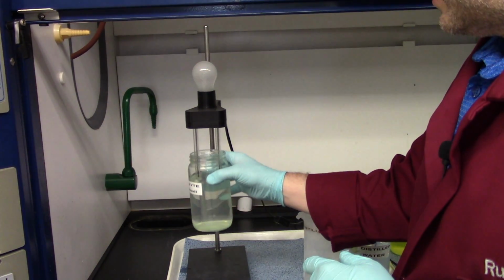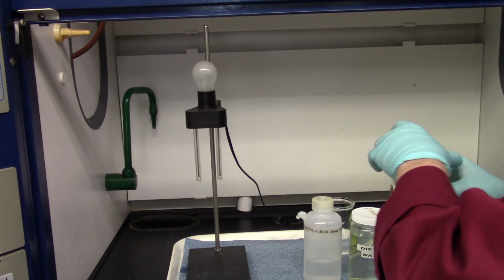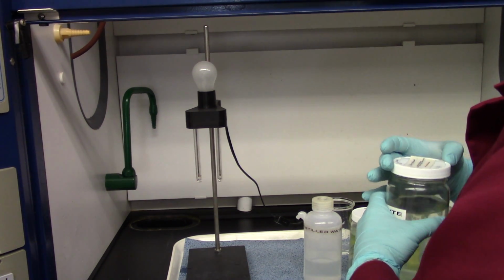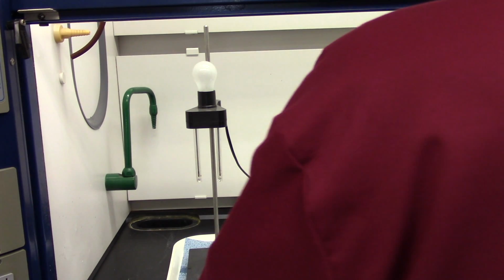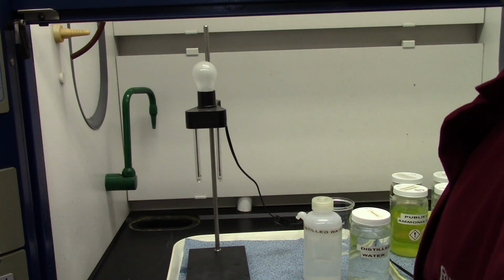I guess you can see it. It lights that lamp very mildly, very, very subtle. And that's because Pedialyte has potassium citrate, which is a strong electrolyte. It also has sodium citrate, which is also a strong electrolyte. So that lit the lamp very, very mildly. The reason why it was so dim is, again, just concentration. There wasn't very much in there.